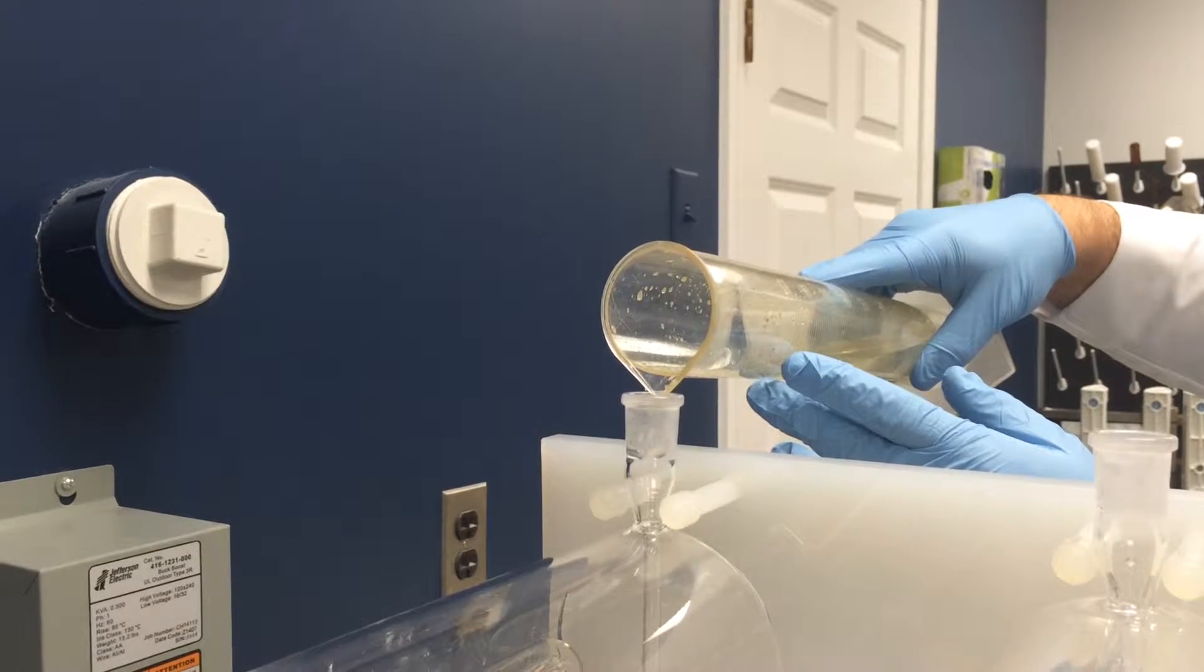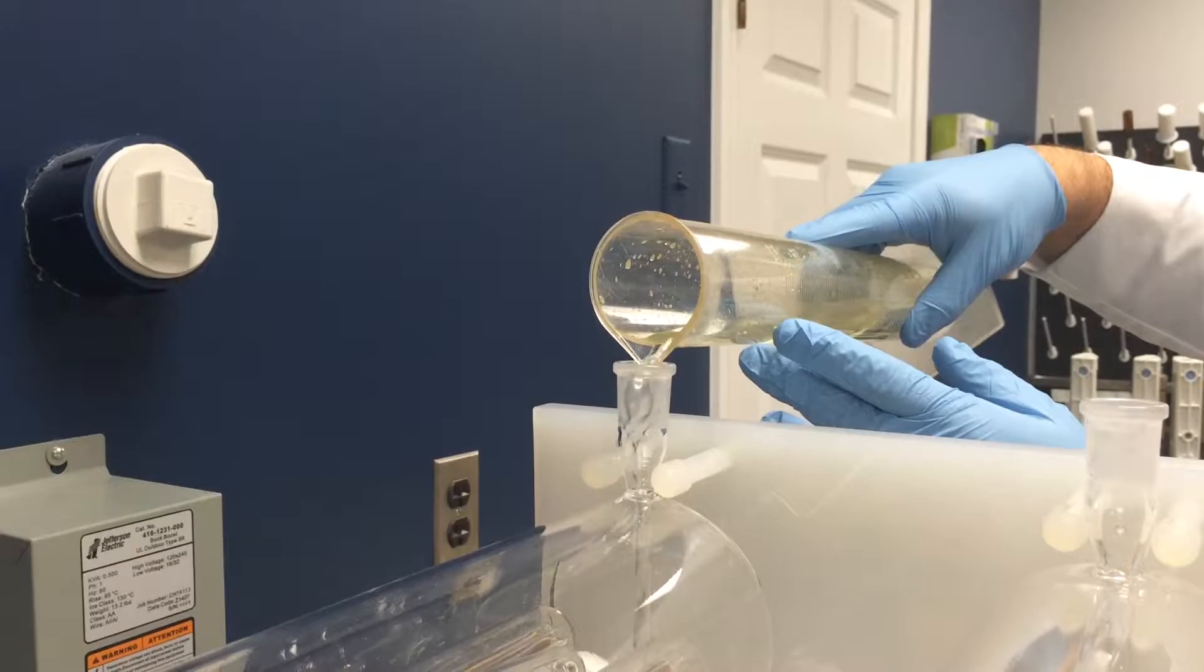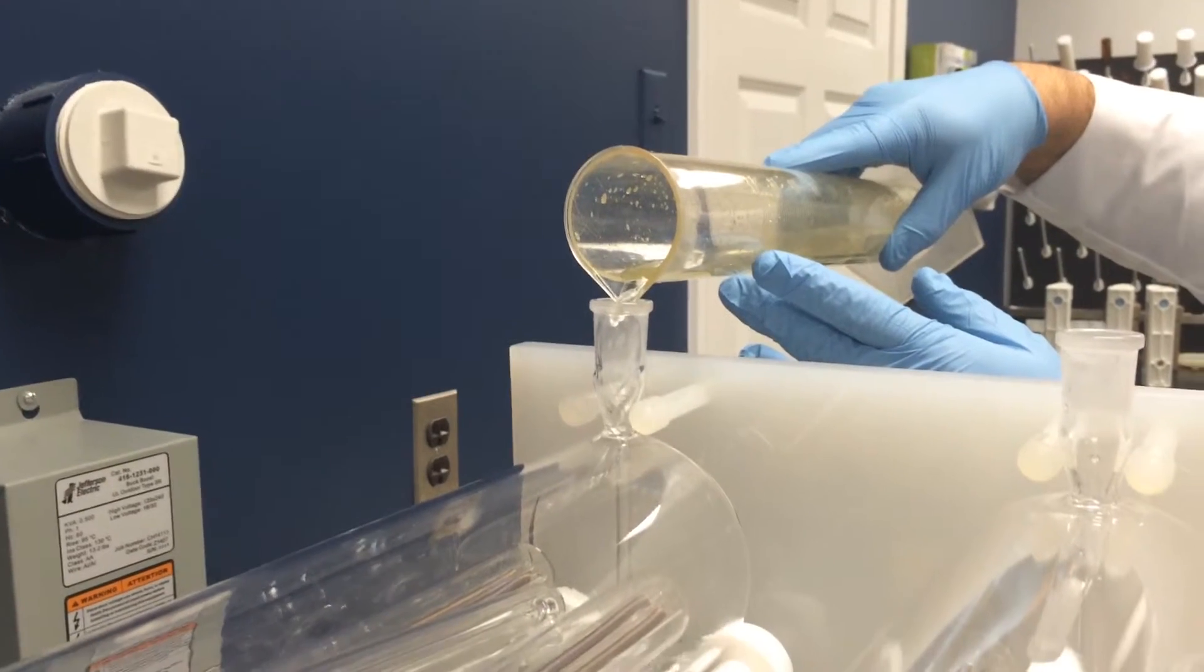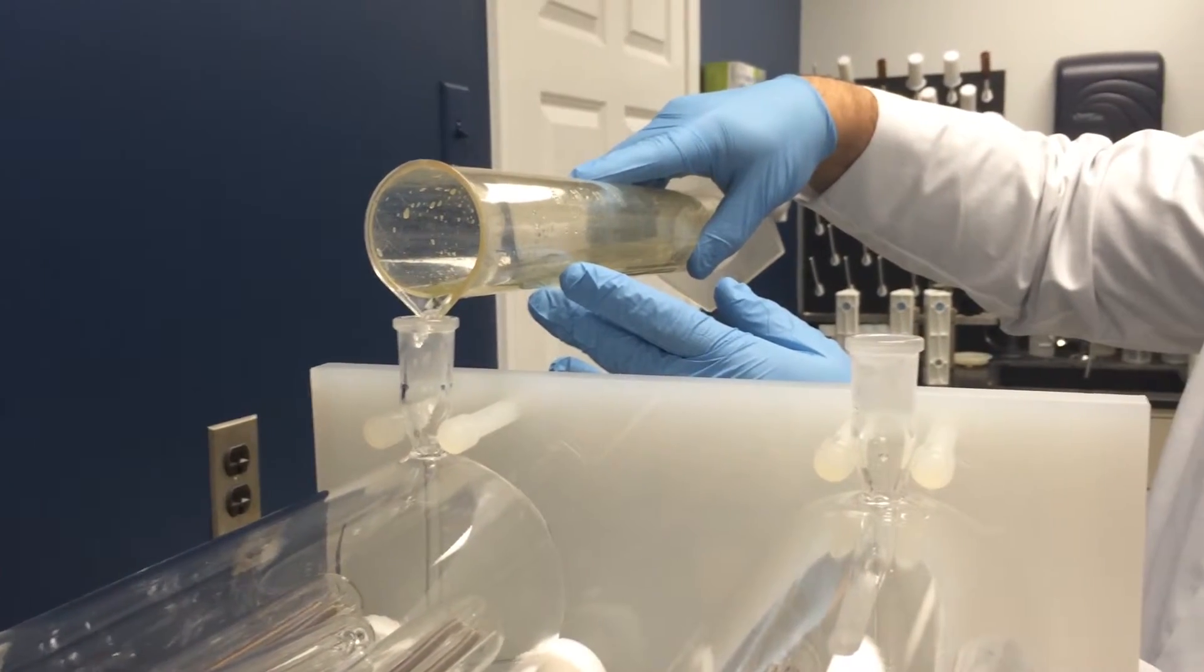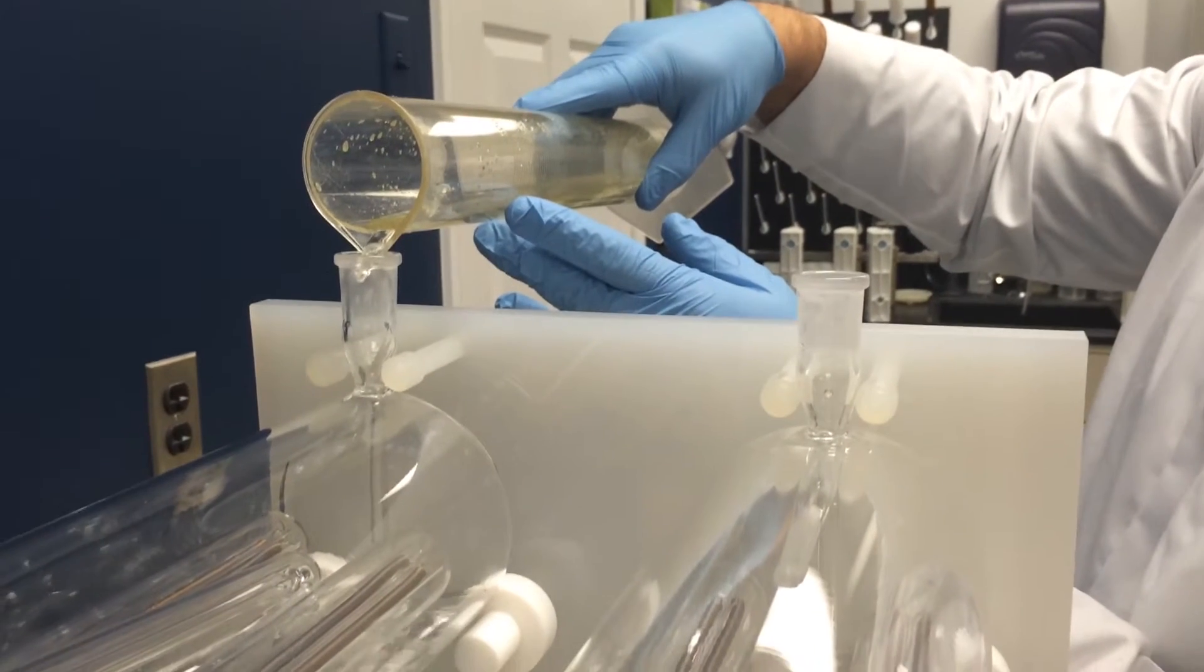The DuoPure allows you to run two separate distillations so you can double the volume of the same acid type or run two types of acids and distill them at the same time.